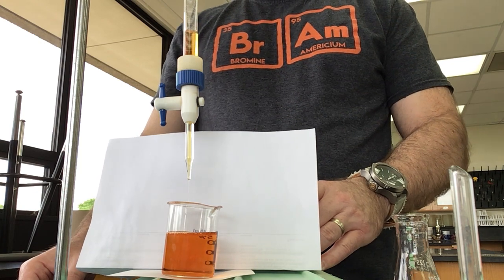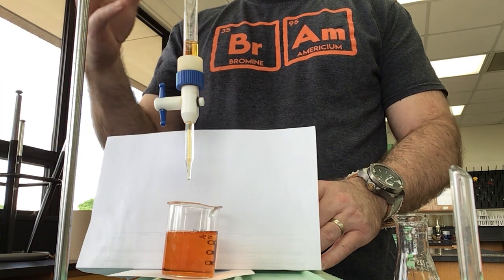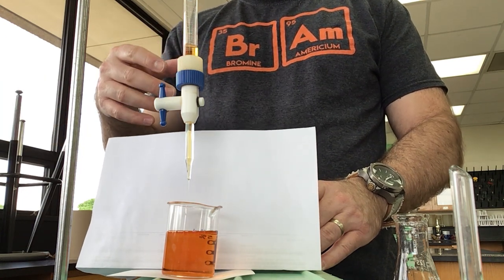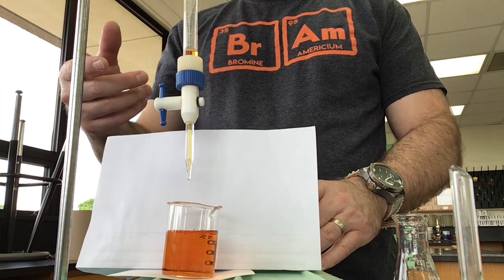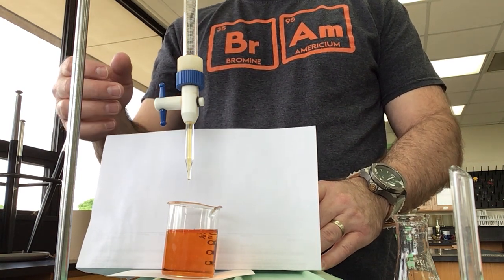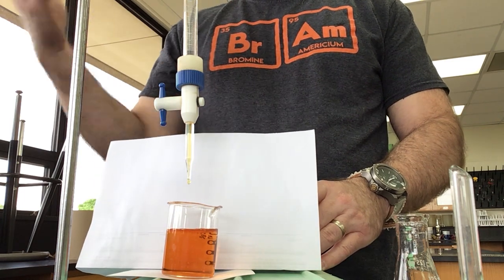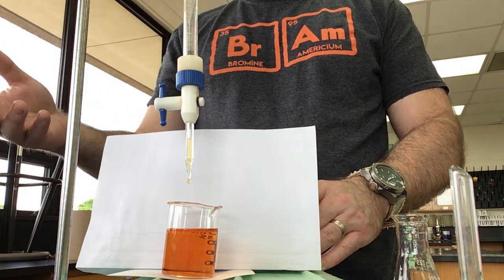If you were in a really big rush you could close this off and dump it out the other end and then rinse it out with water. You could also empty this out with that method if you got a clog in your burette tip and you couldn't get any of your titrant out to try to clean it out.